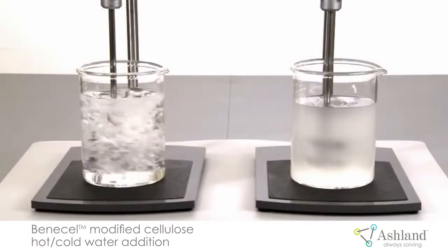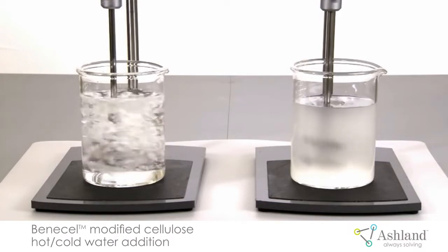These lumps get caught up in the vortex, making it much more difficult to hydrate. The solution will hydrate, it will just take longer.